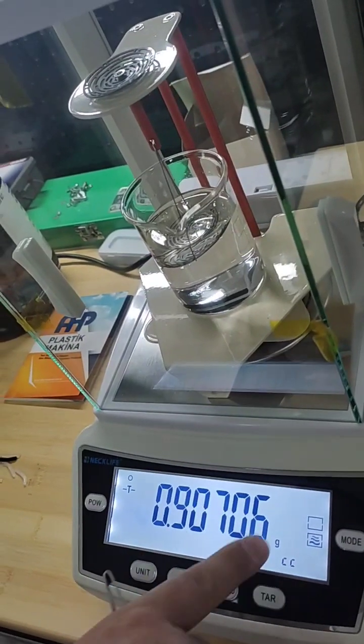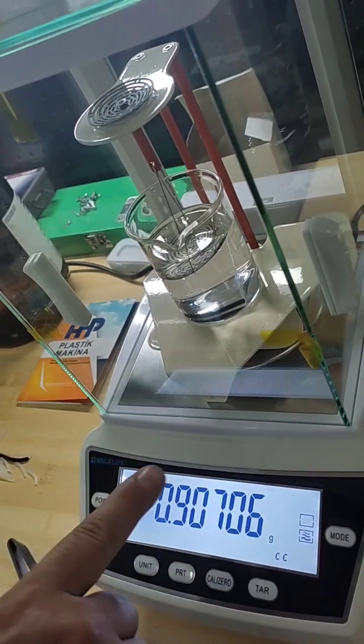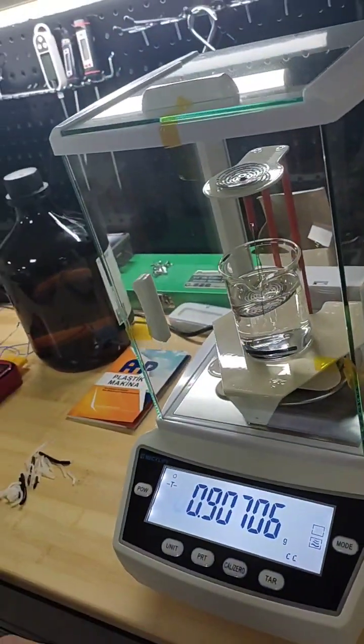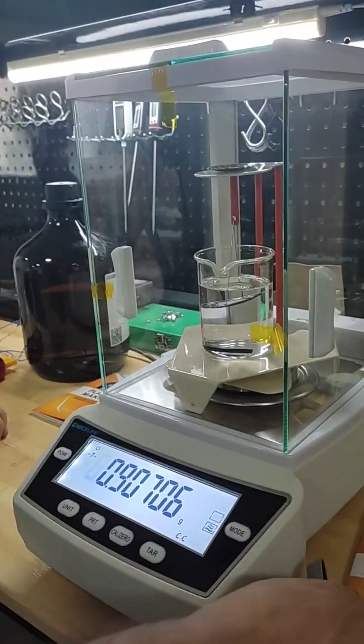And now it shows the density of the polymer directly. No need to put the figures into the formula for density measurement using immersion method. Thank you all.